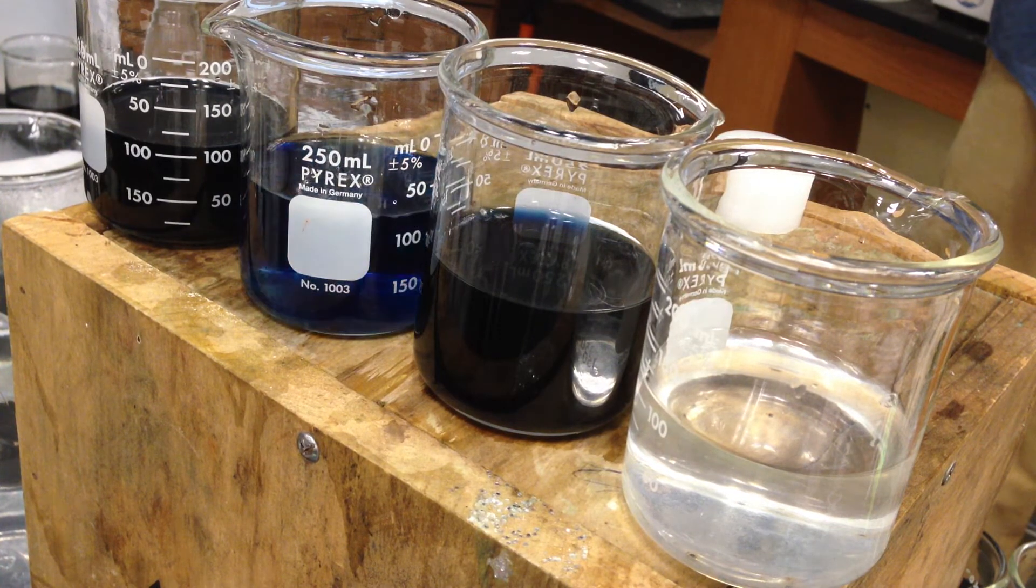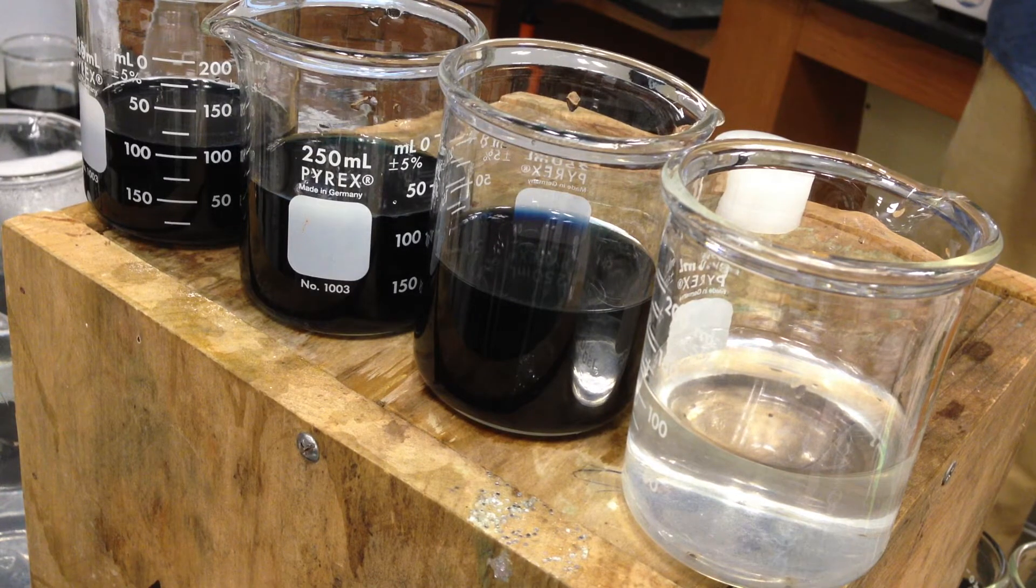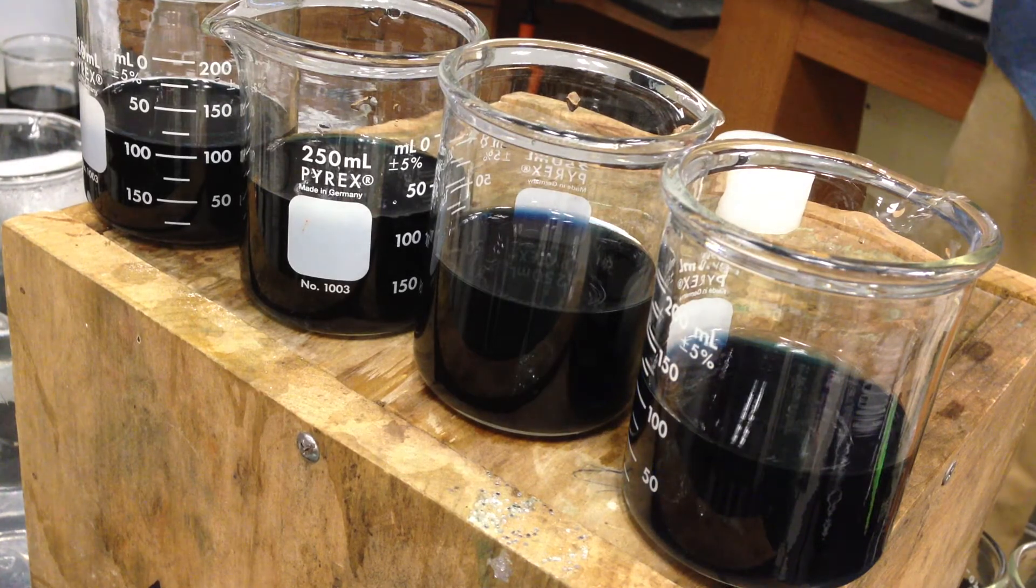It did not go the way I wanted it to go. But you guys get the point. I could have poured faster or I didn't measure right. Okay, so that one's not on track. Alright, so three out of four.